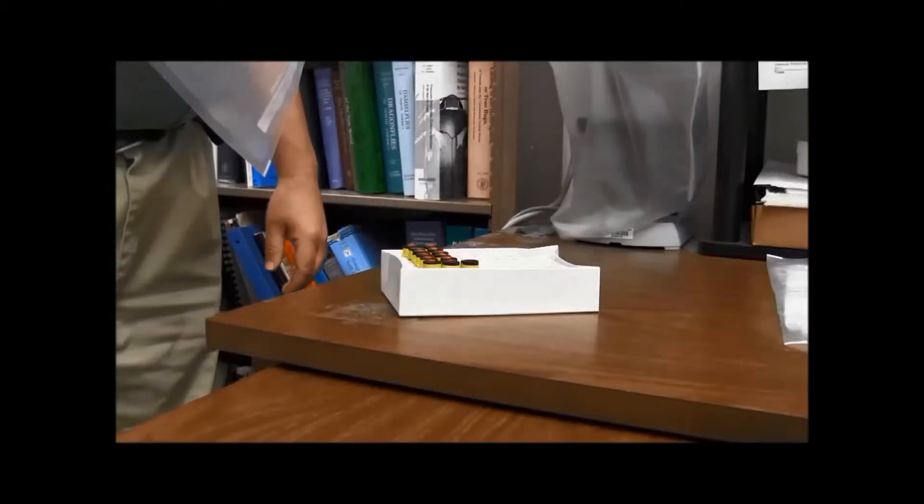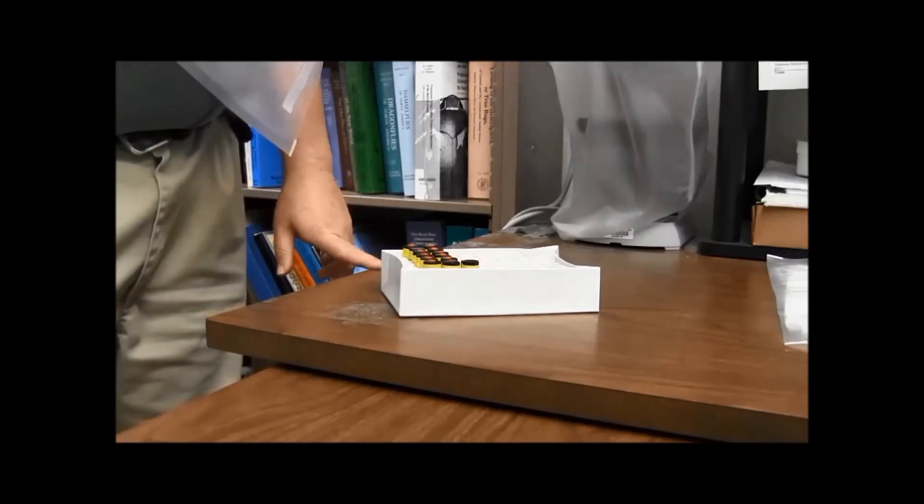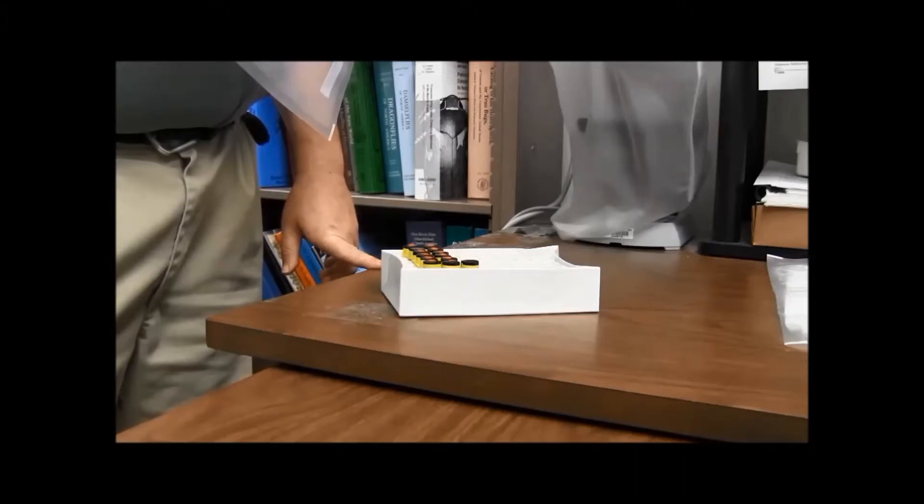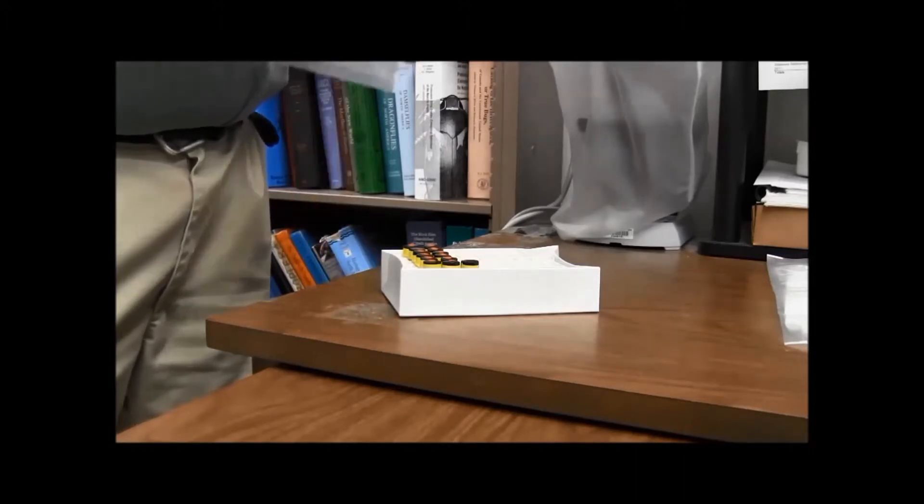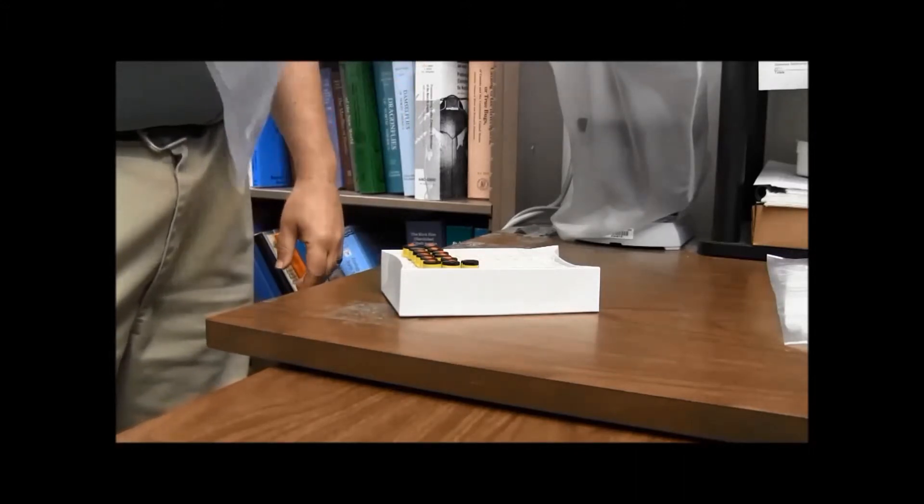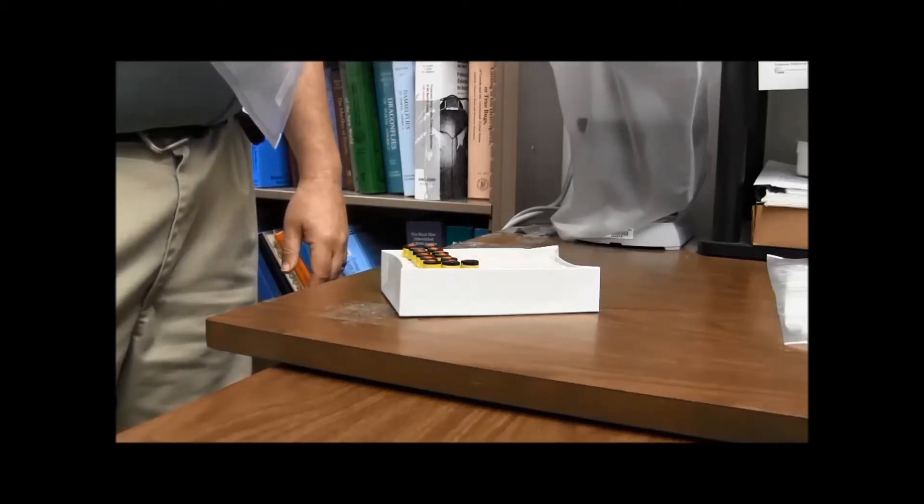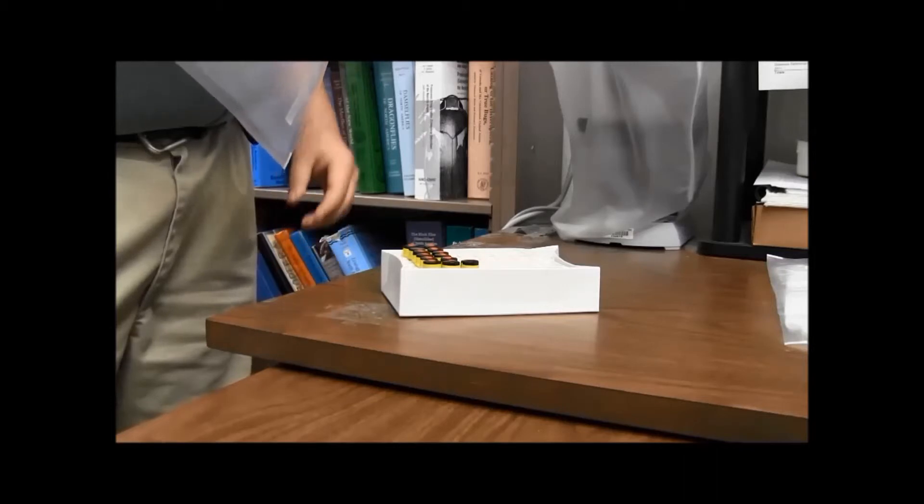So we're packaging these vials up according to what's called the Special Provision A180. It's part of a large group of regulations that you have to follow when you package and then ship any sort of hazardous material, which ethanol would definitely fall under.